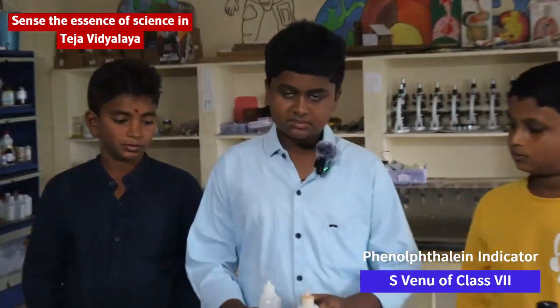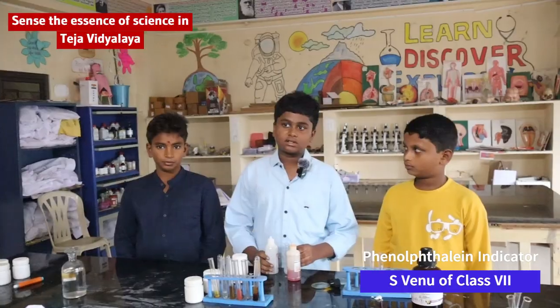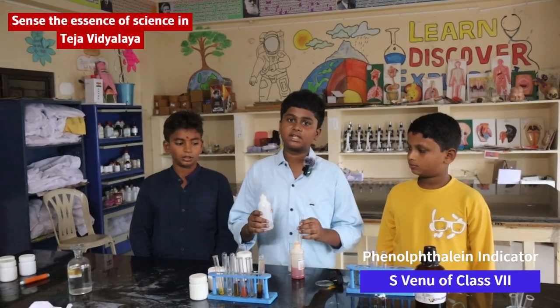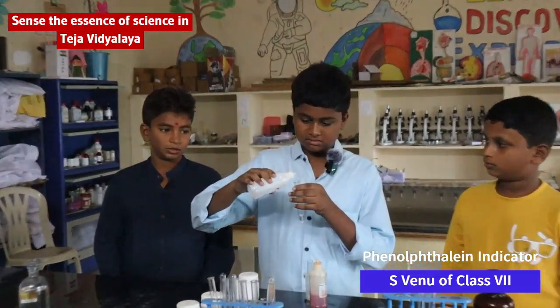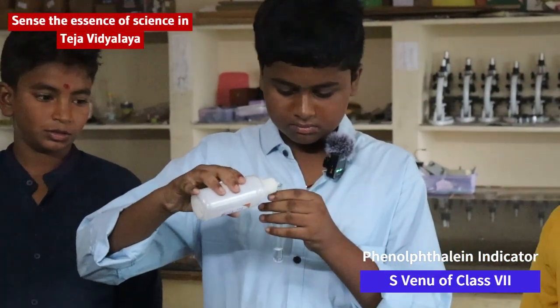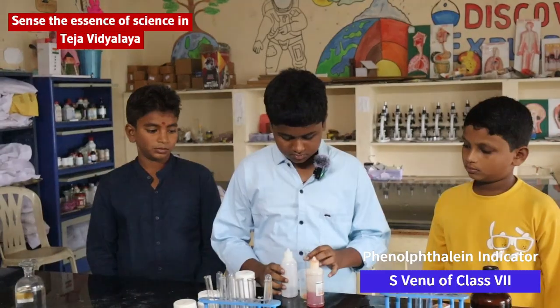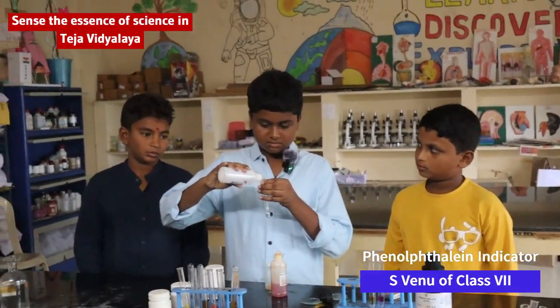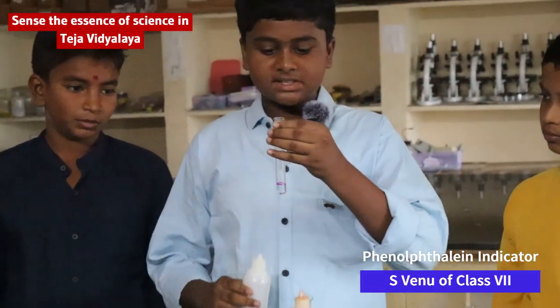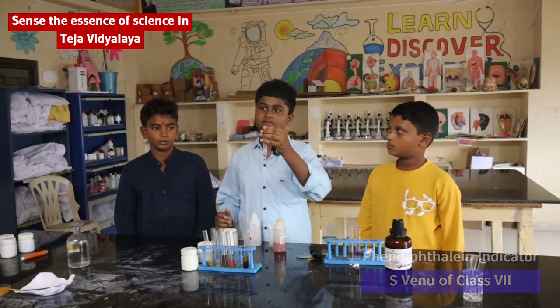My name is Venu. Today we are telling about phenolphthalein indicator. Let's look. It does not change its color. It is acid. Now look. It changes color. It is base. It is pink color.